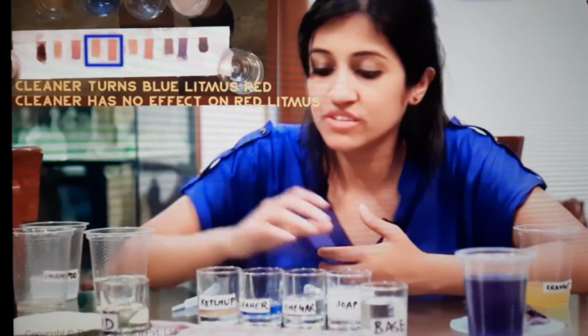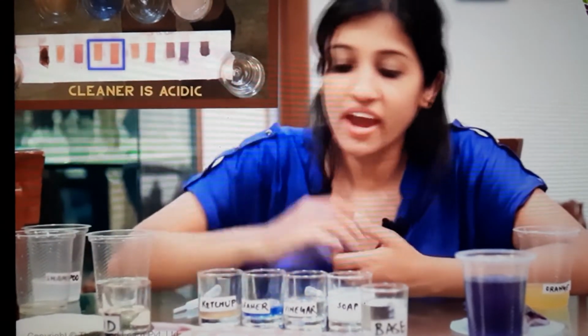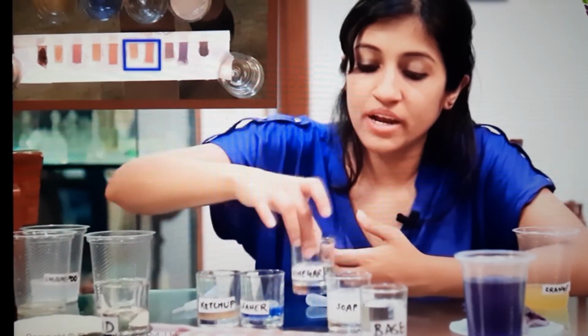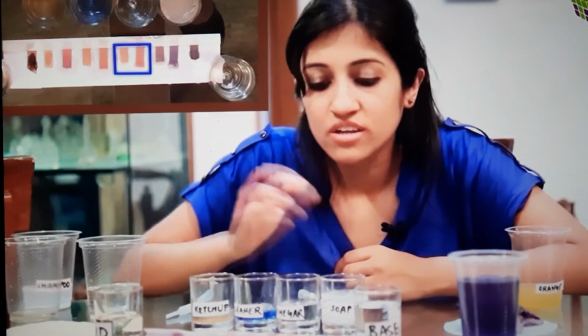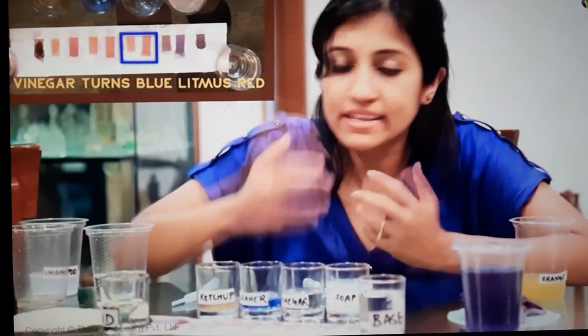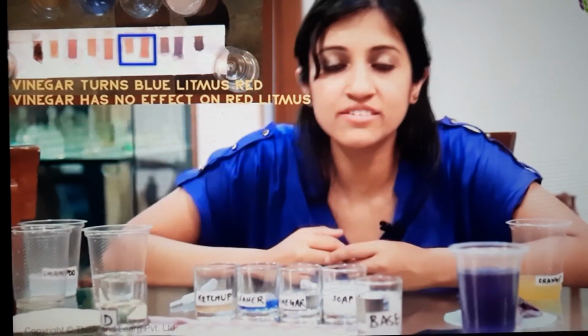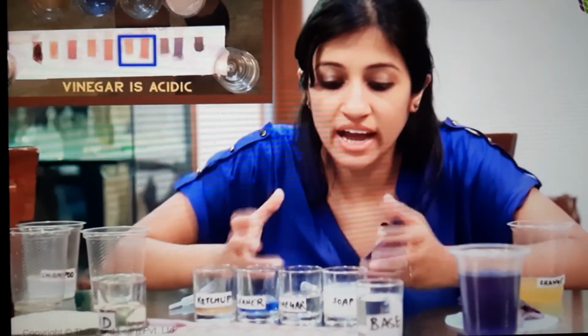It turned blue litmus red, but nothing happened to the red litmus. Again, the cleaner is also acidic. And the vinegar also turned blue litmus red, like you can see over here, and nothing happened to the red litmus. Which means vinegar is also acidic.